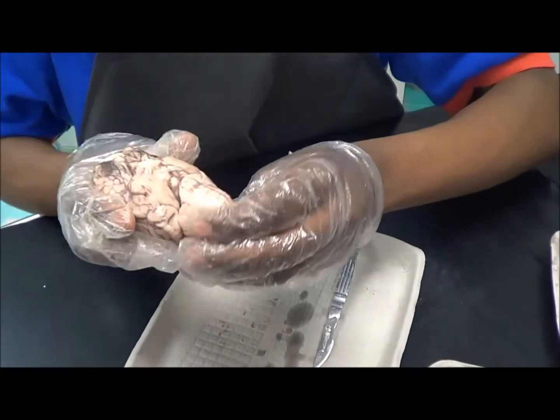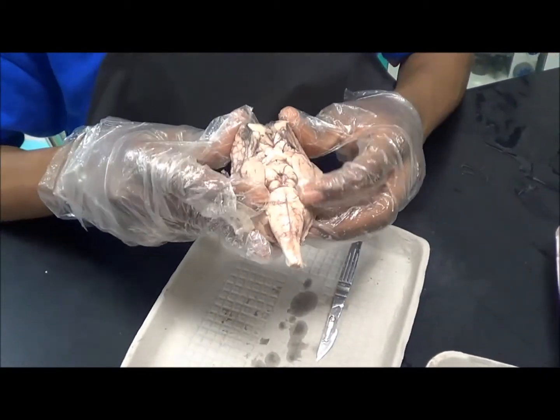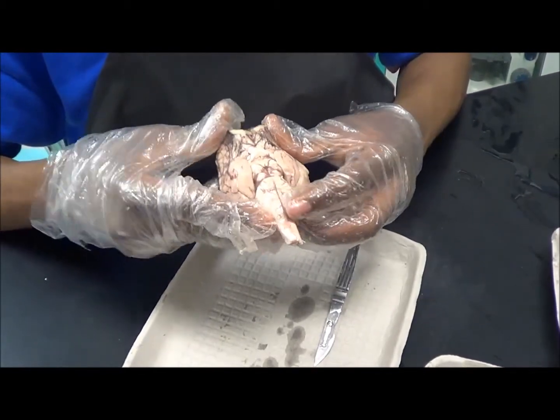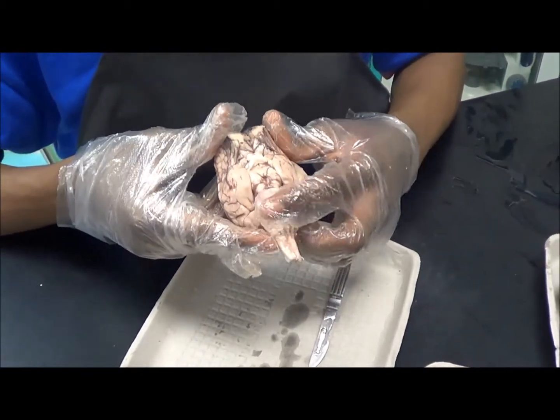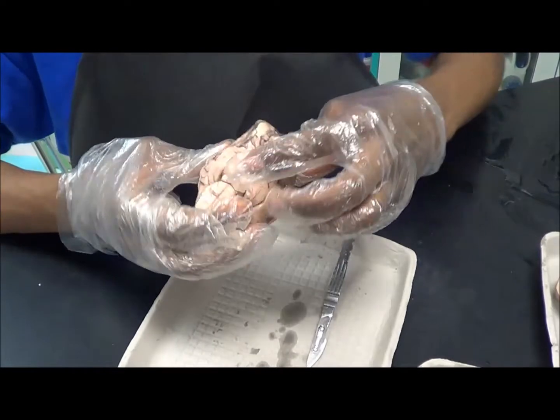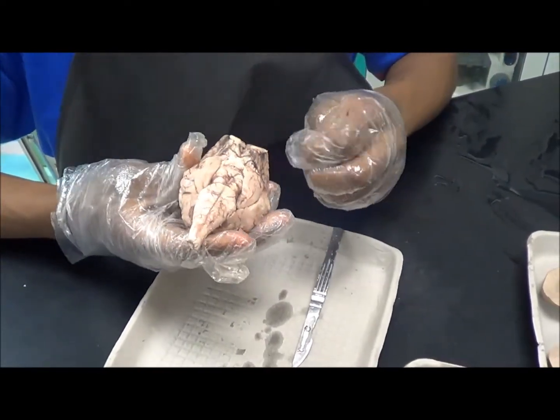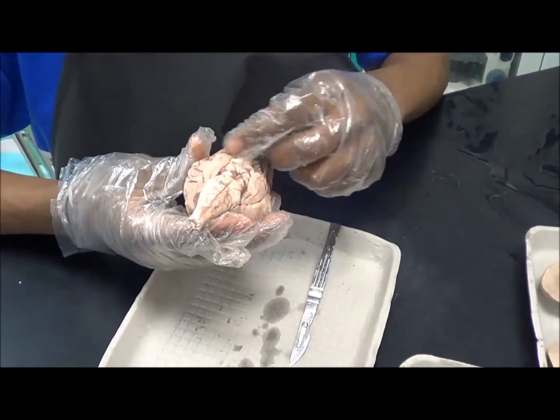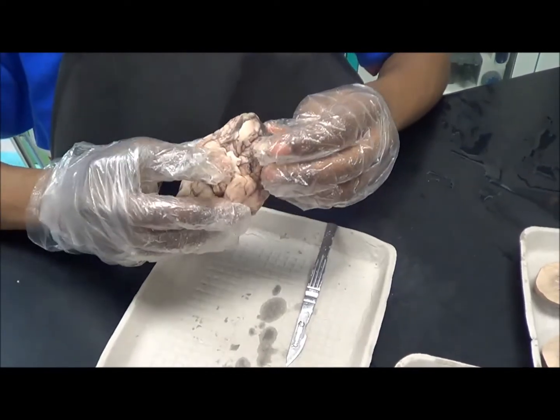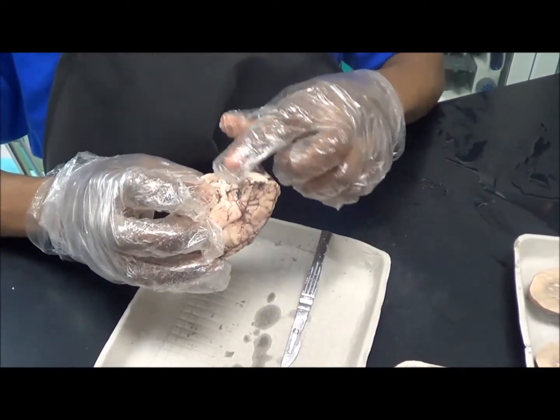As you flip it over, this part right here is called the pons, this is called the trapezoid body, and this is called the medulla. This part right here used to have the dura mater, but they cut it off before they sent it. And the olfactory bulbs used to be right here.